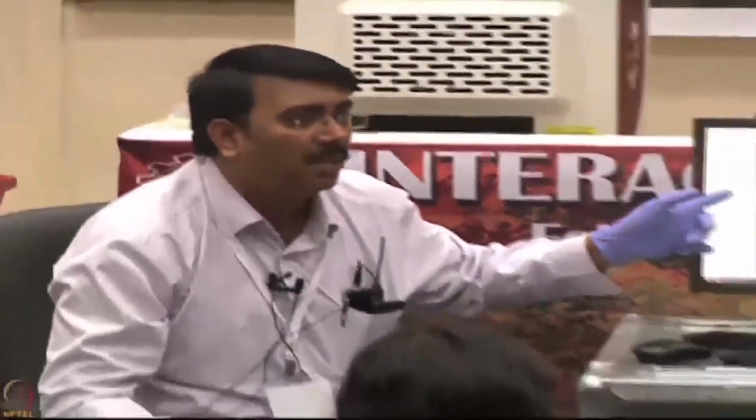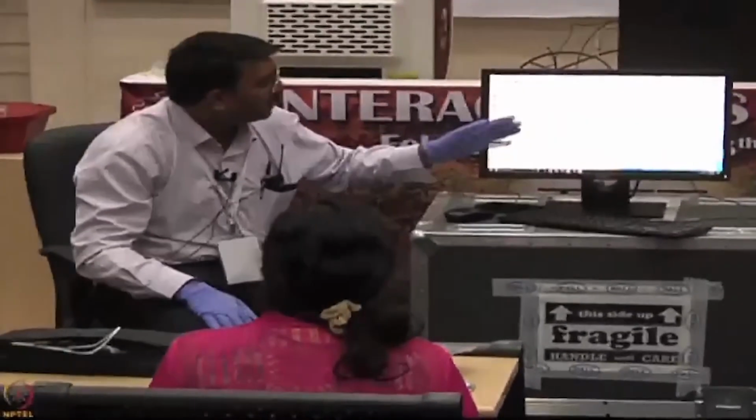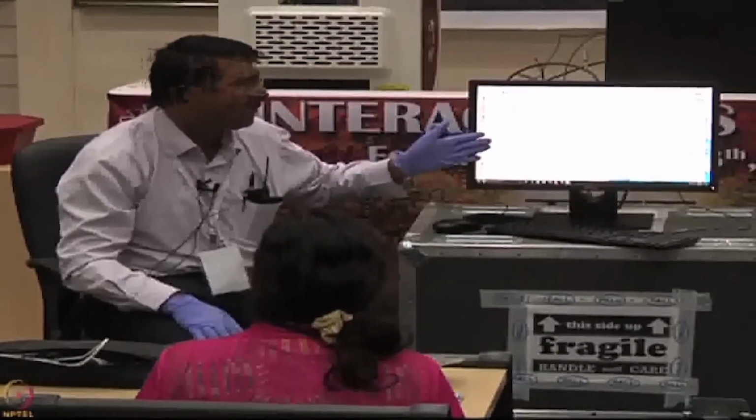So I saved my time. Otherwise, if you forgot this one, hydration, then you can check in this. So after 10 minutes, the experiment will start. Or otherwise, if you want another 20 minutes also, you can assign the time, how much you require.